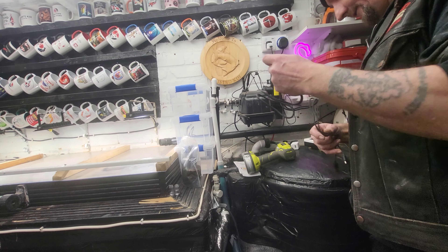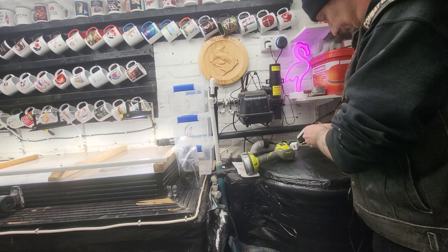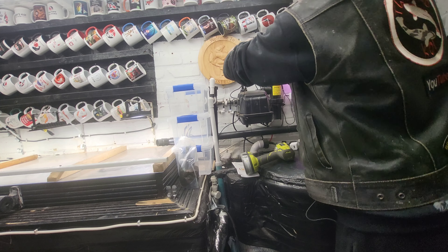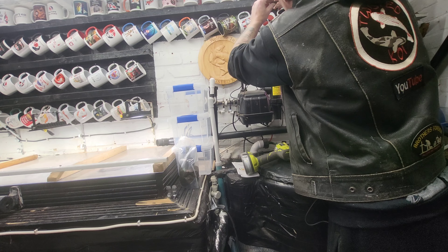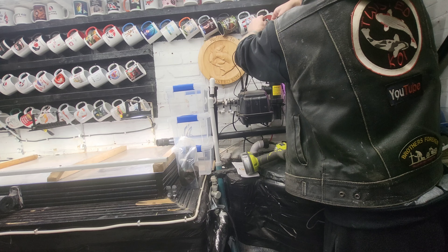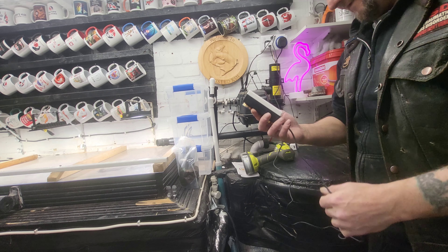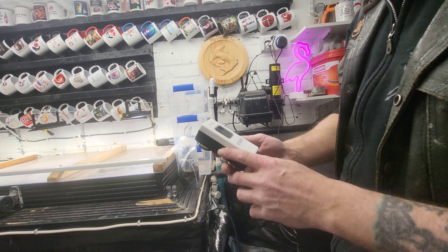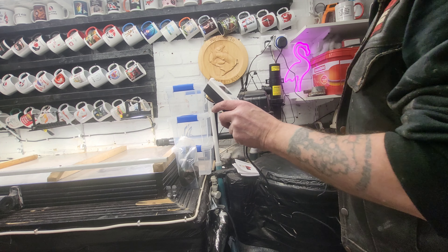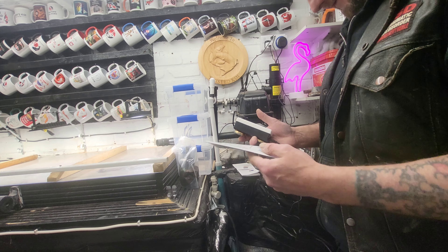I'll get the lid back on now that the probe is in the correct place. I'll get this lead plugged into the bottom of the display unit - like so. Making sure it's facing the right way, and that one in there. Oh, we now have a readout! Everything says zero at the moment.